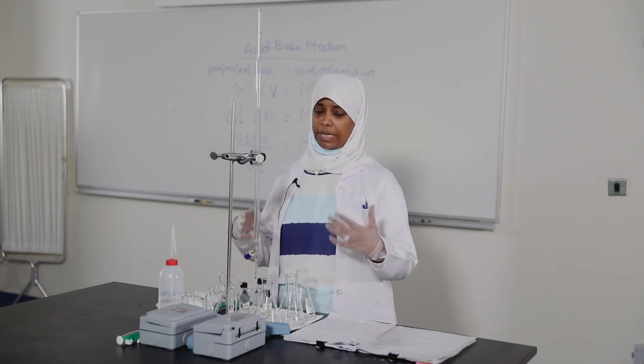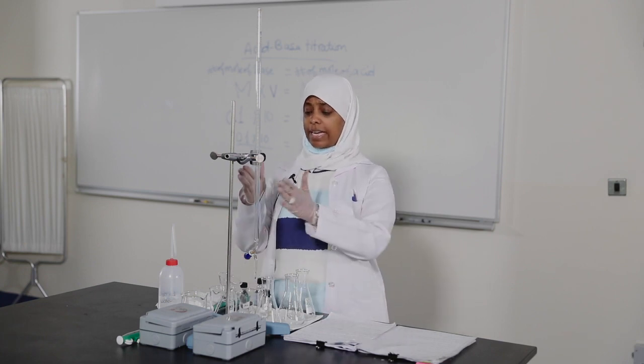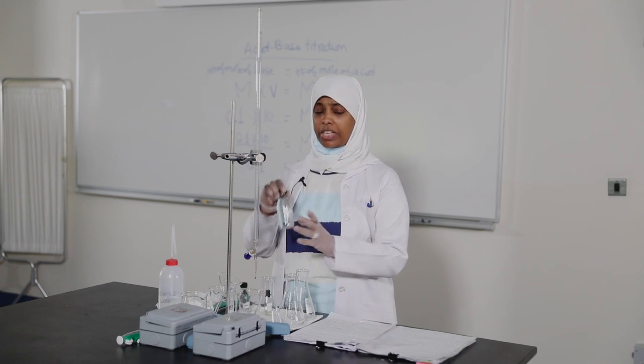What is the meaning of standard solution? A standard solution is one with a known, exact concentration. In today's experiment, the standard solution is NaOH, because we know its concentration exactly.